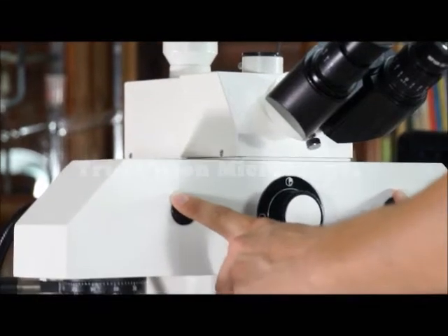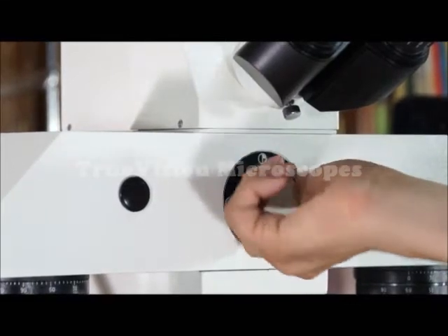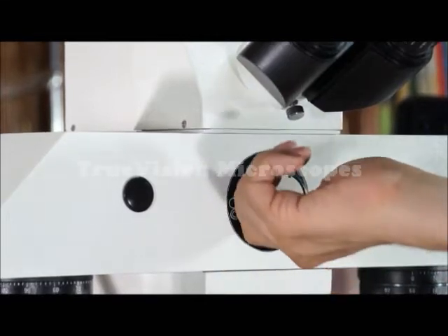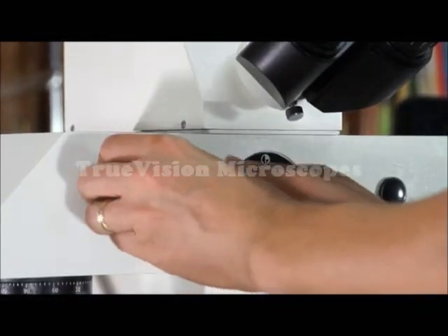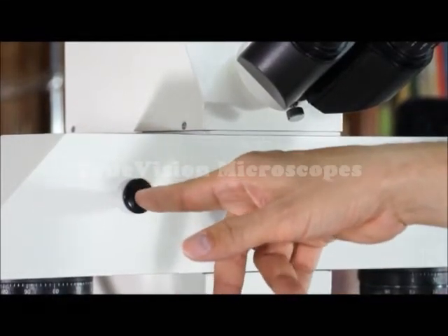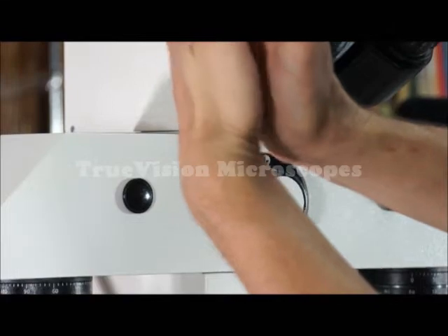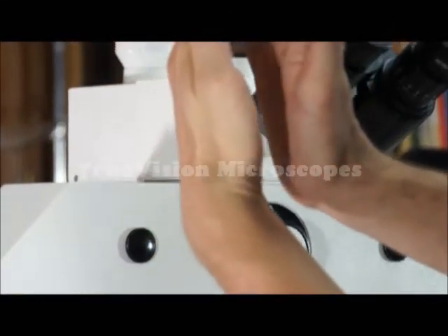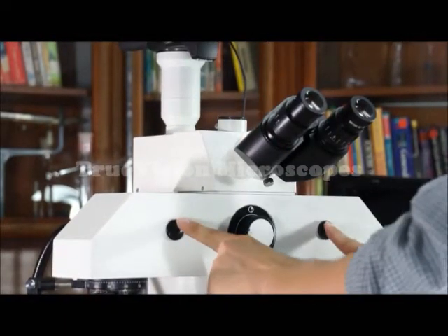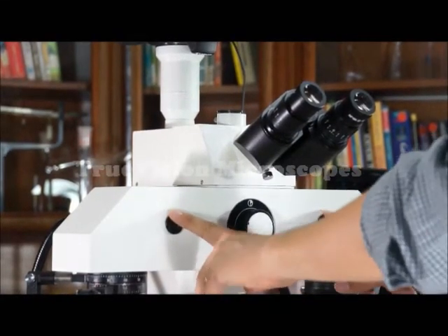These ports are for adjusting the separation line. This also moves your separation line. You take these caps off, pop them off, and you can access an adjustment lever inside with a screwdriver. One adjustment lever adjusts the width of the separation line, and the other adjusts the taper of the separation line. So if that is off, then take out these knobs and do the proper adjustment.